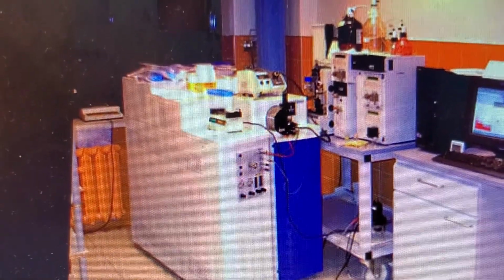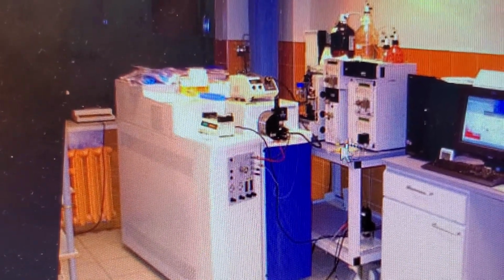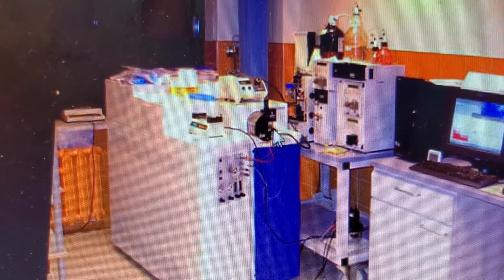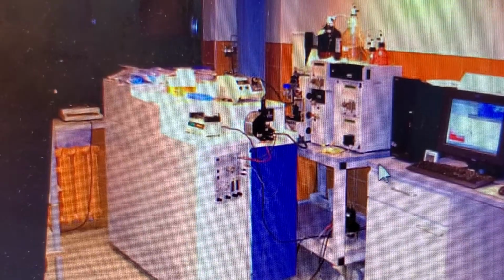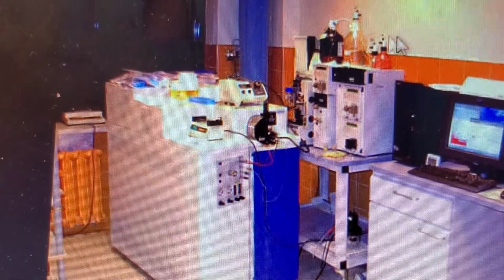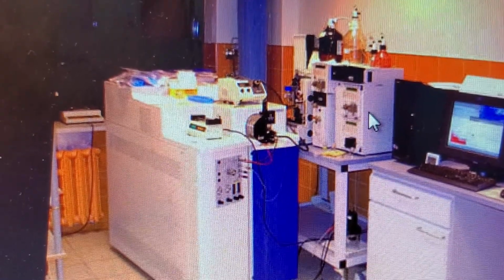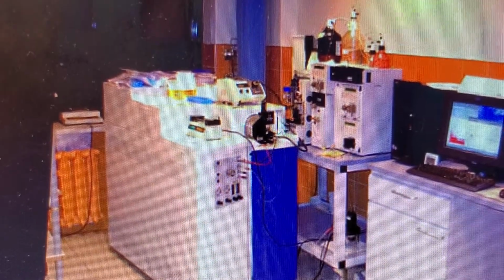This is a somewhat bigger version of it, and this portion is the metallic portion you saw in the previous model. Here next to it you see a chromatography machine, HPLC, to analyze the mixture sample, and then automatically the separated samples one by one will be injected into the machine through this module.